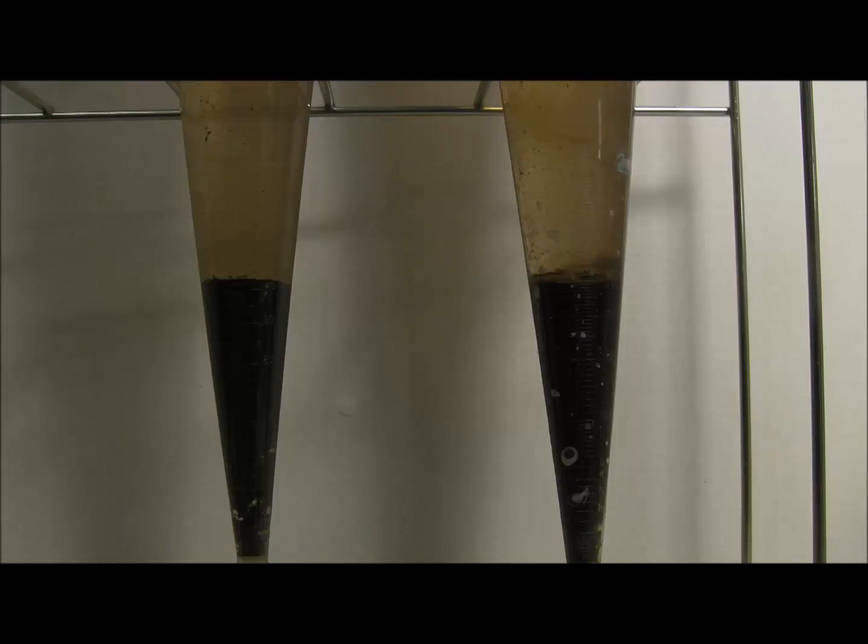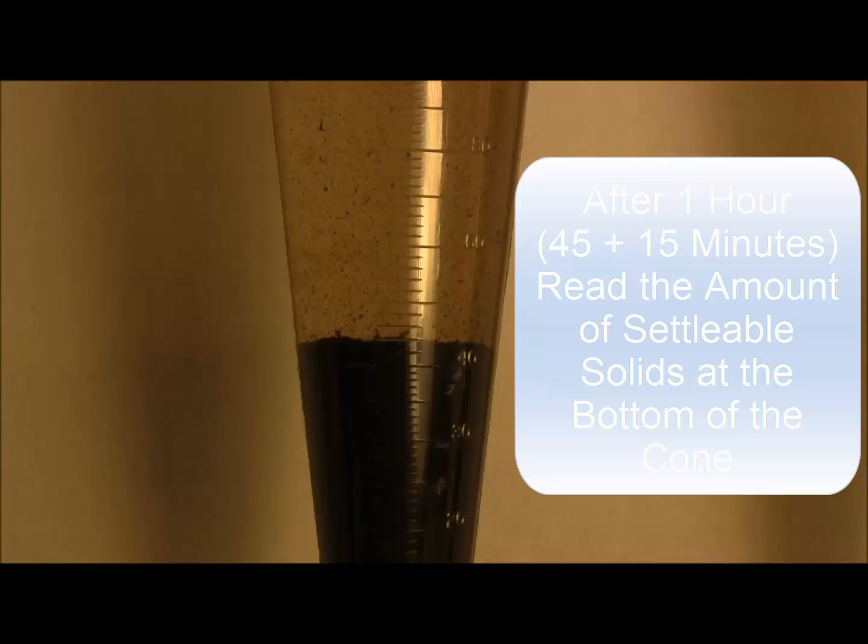When one hour has passed, you can read the amount of settlable solids that have accumulated at the bottom of the cone.